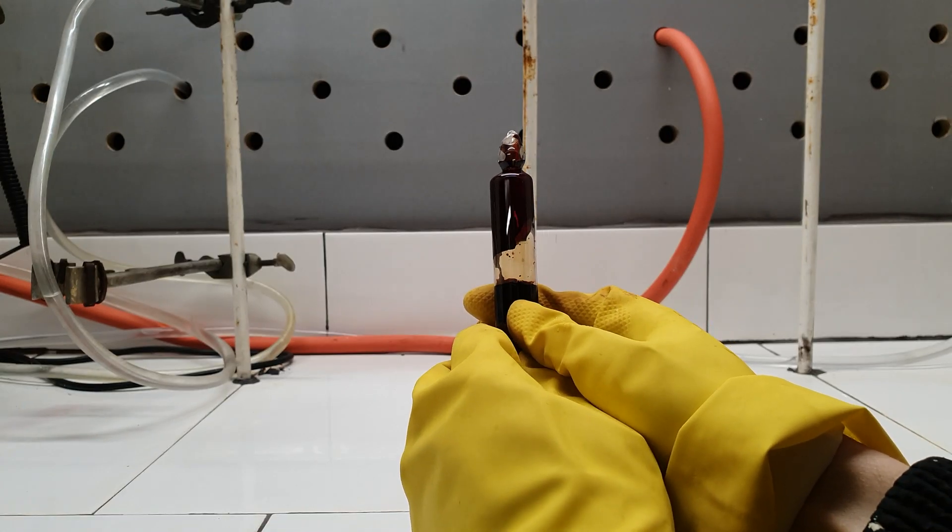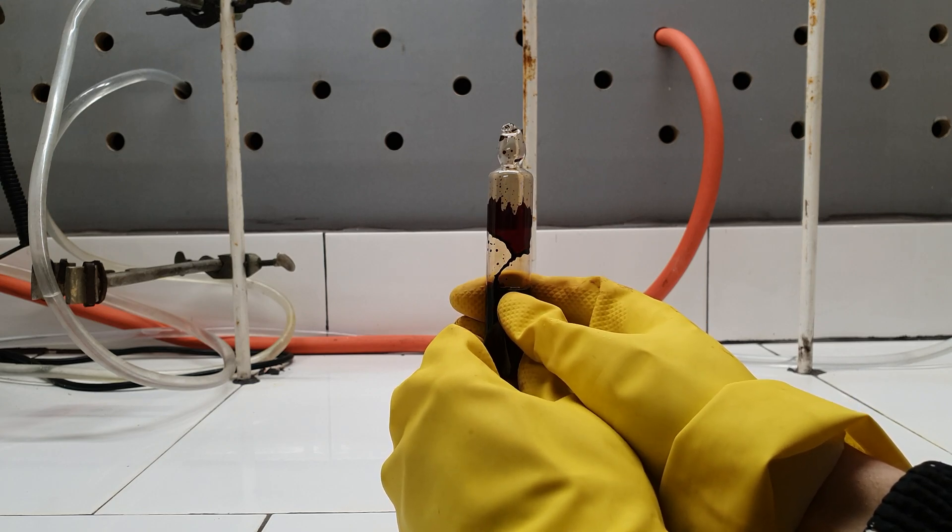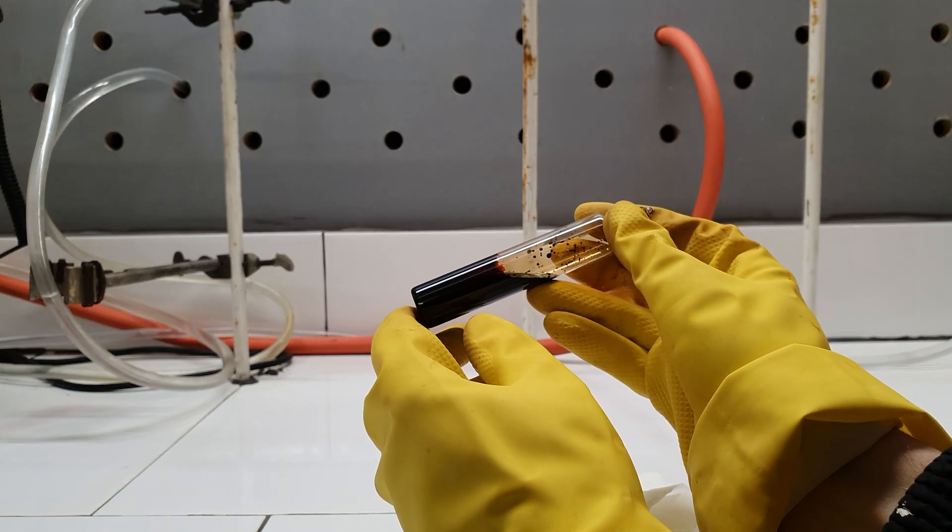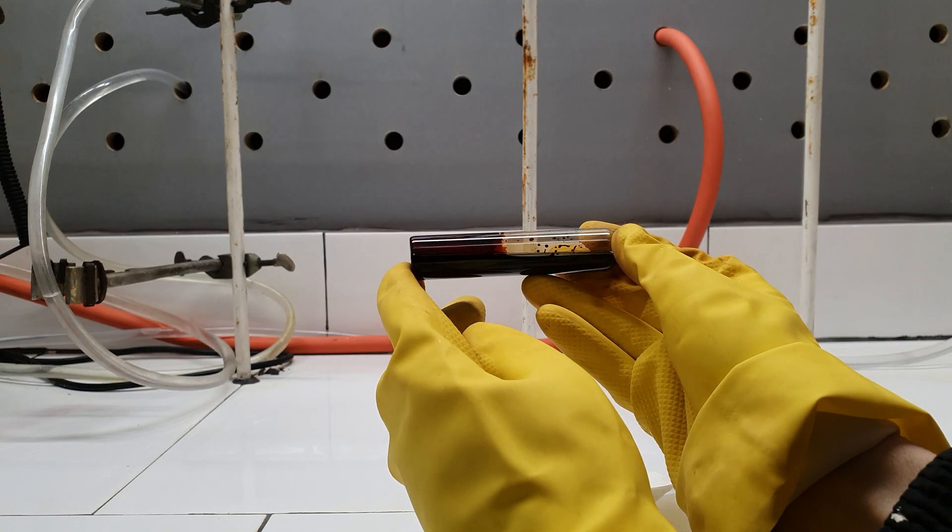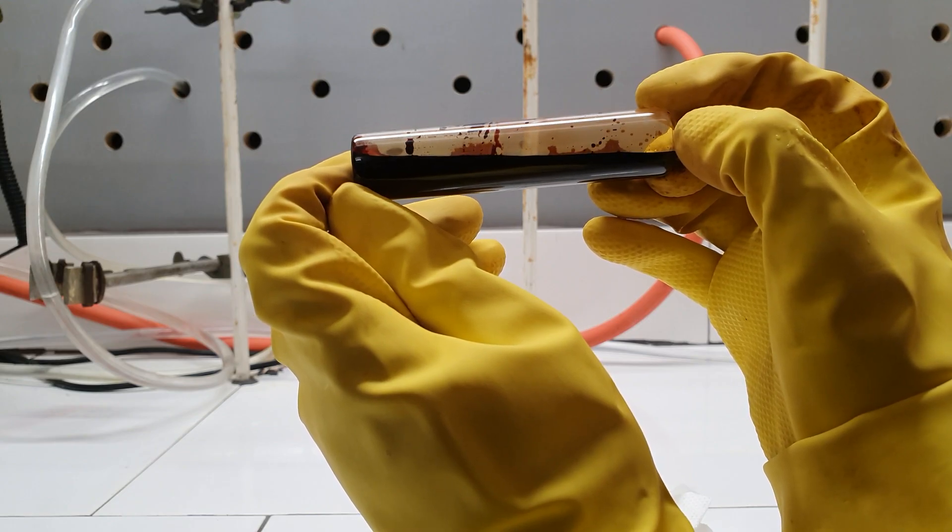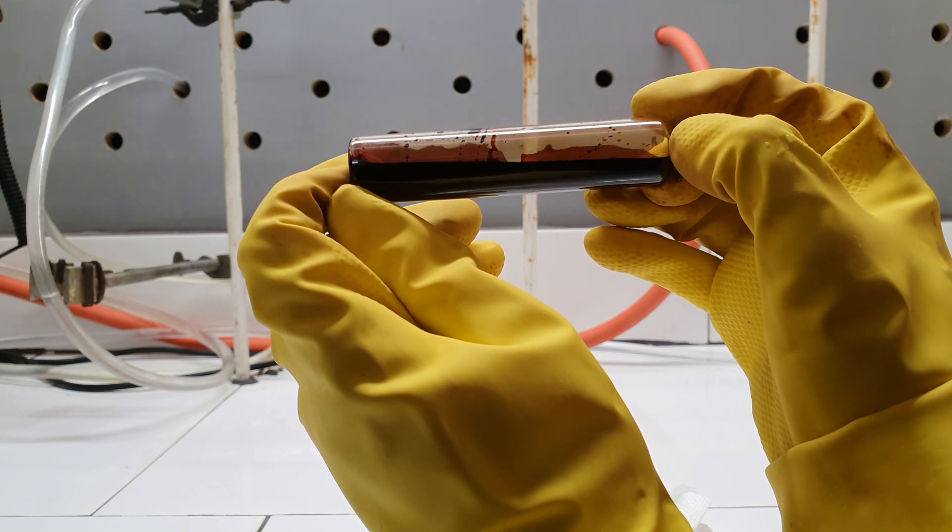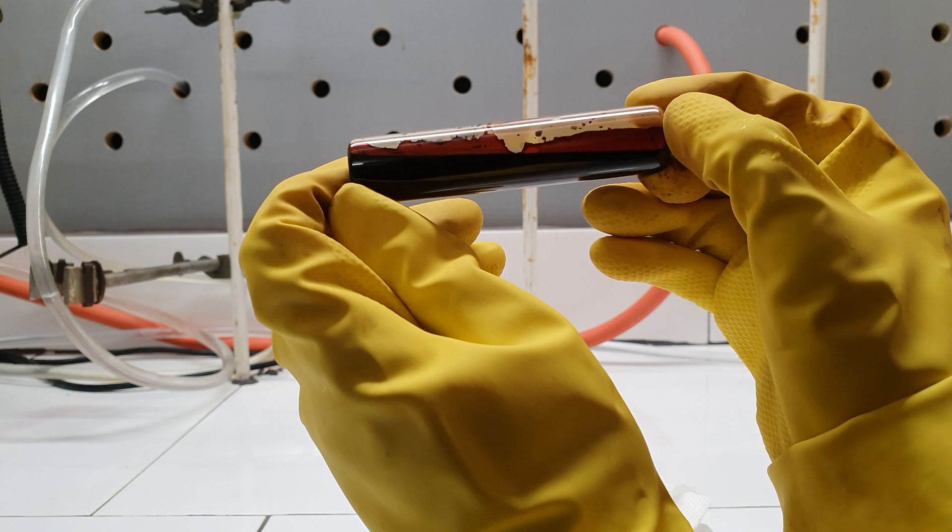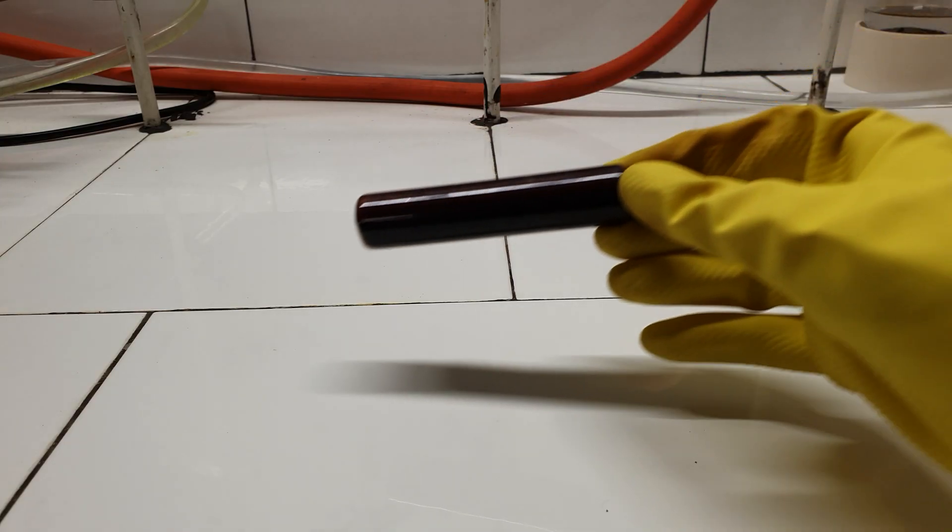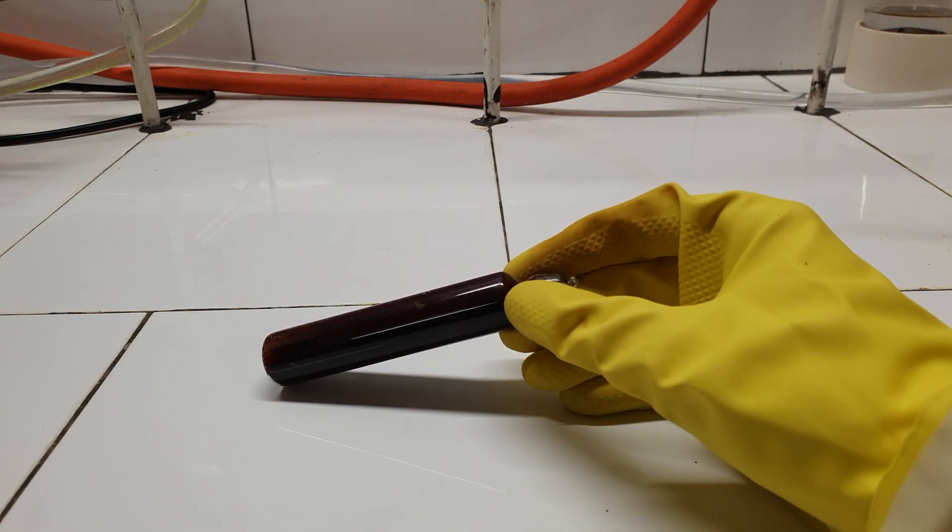In the ampule, you could see how much this chemical reminds of bromine. I left the ampule for 30 minutes and when I came back, all of its contents had frozen.